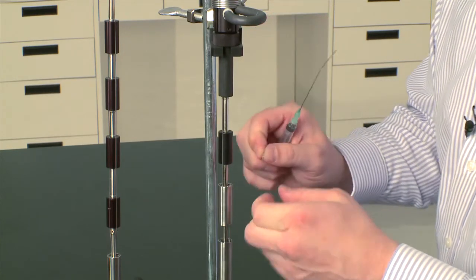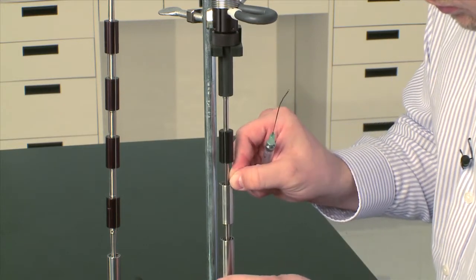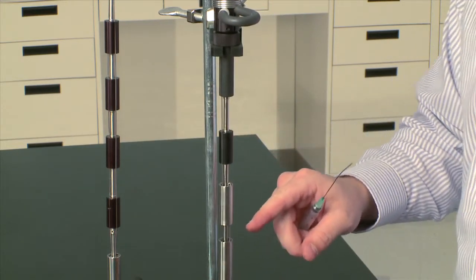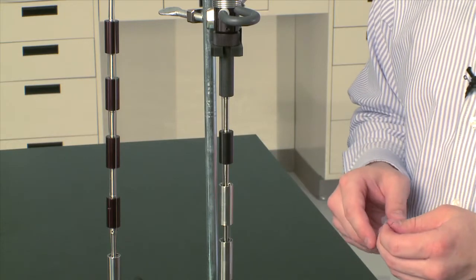You can return the plug, put it back in place, fill up the one on the bottom, and you're ready for an experiment.